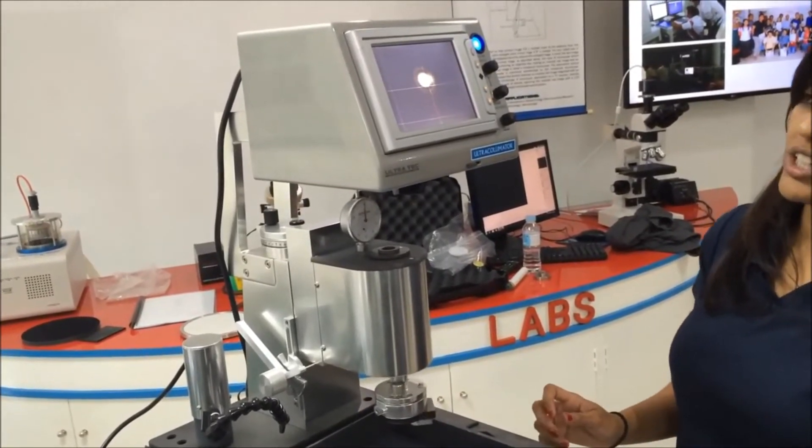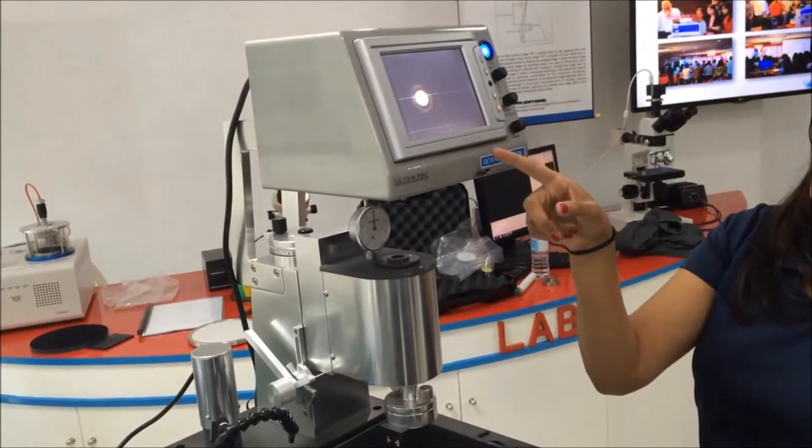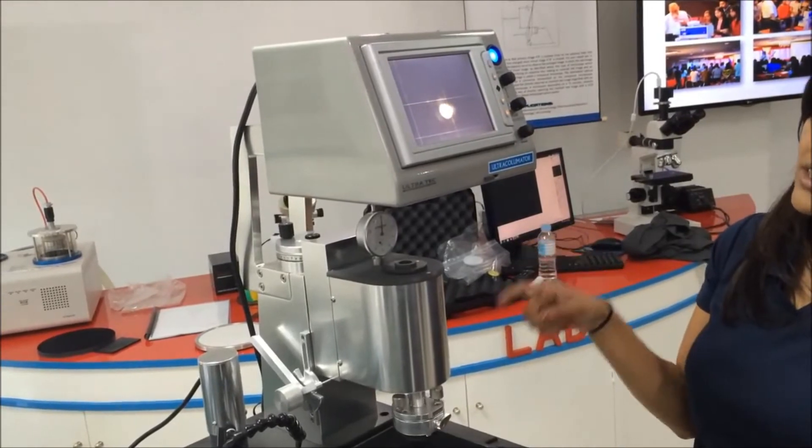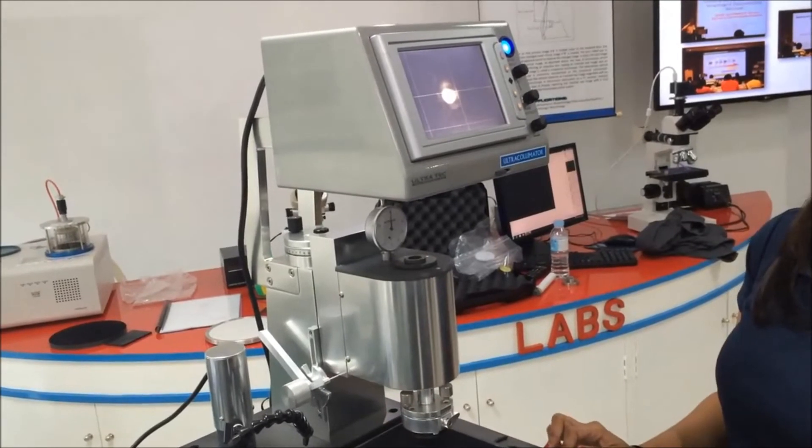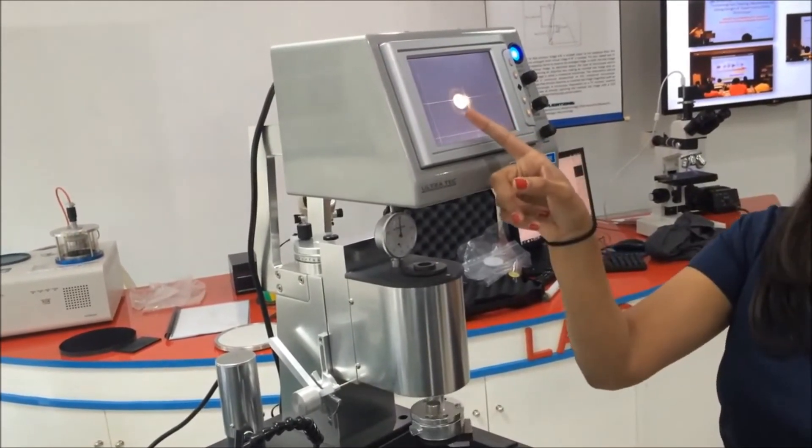And then you turn the rotation on again and see where that center rotation is. Find the center again until that dot does not move.